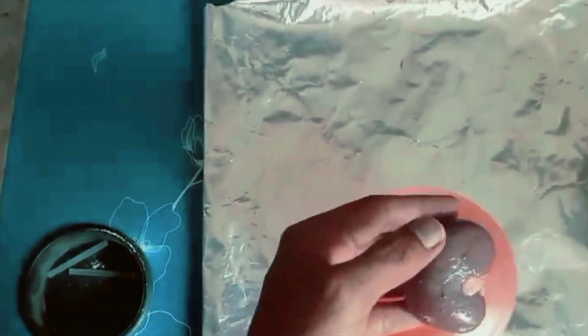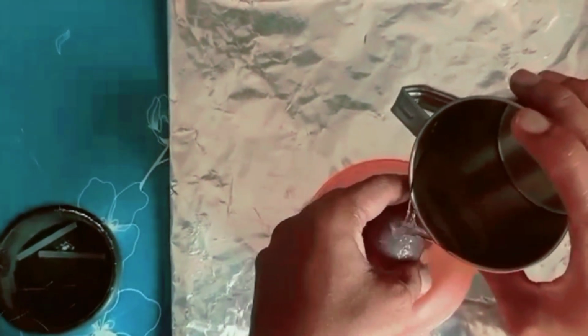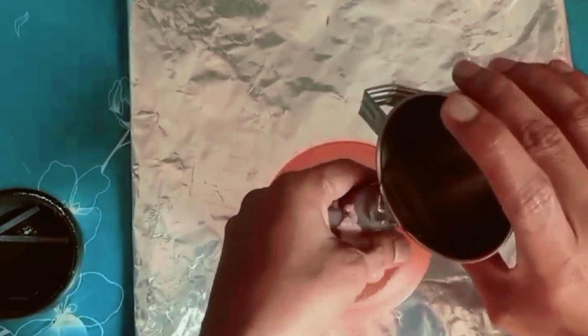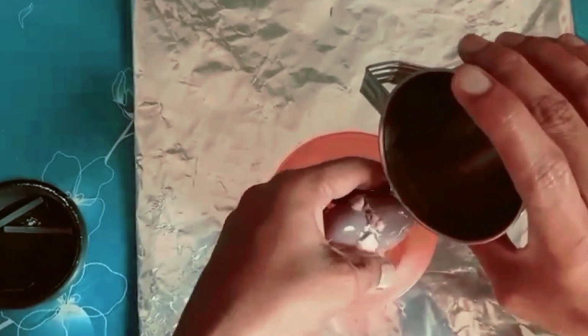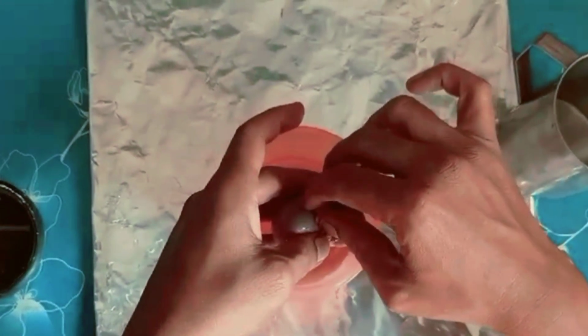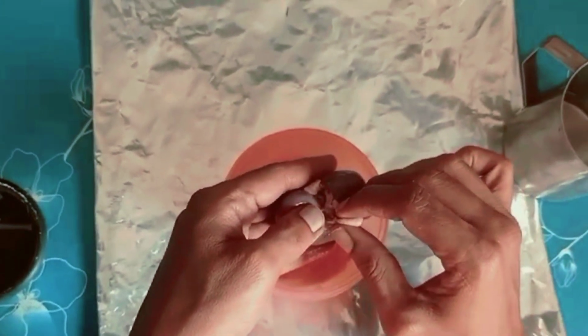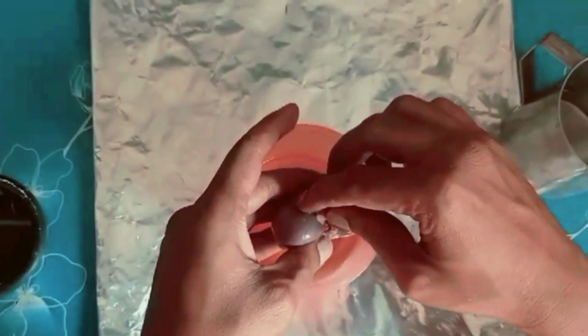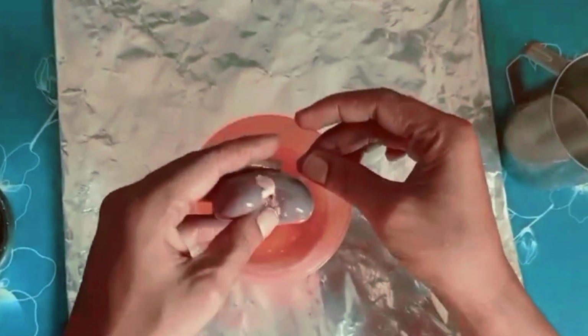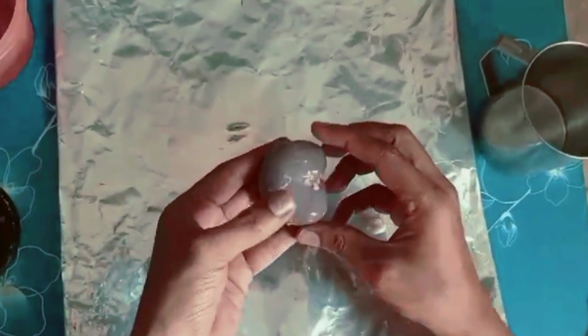Let us start this process of observing the goat kidney. First of all we need to clean it with water. We have taken the jug of water to clean. We have cleaned it. See, we are removing the unwanted materials. Actually we have to take a pair of gloves also, but they are not available, so we are using our hands directly, right? This is the kidney.